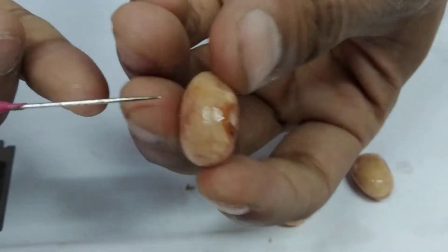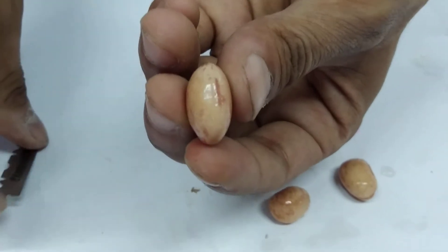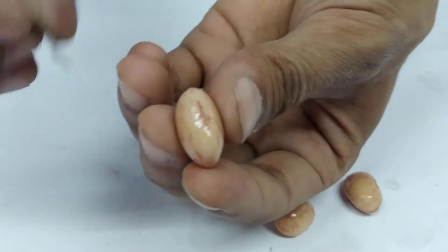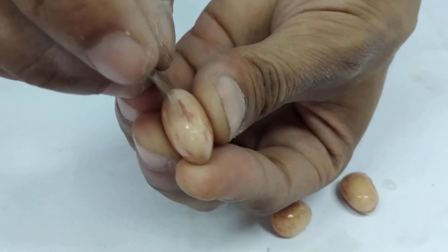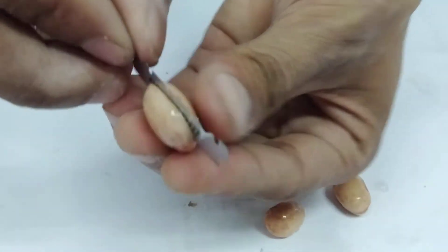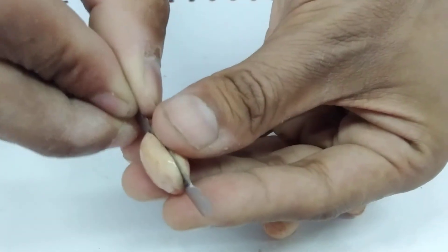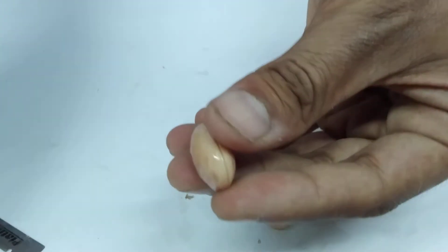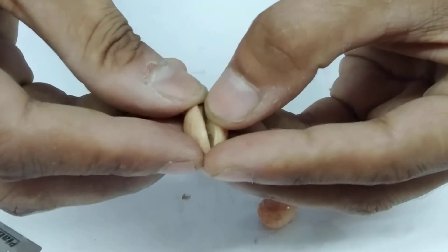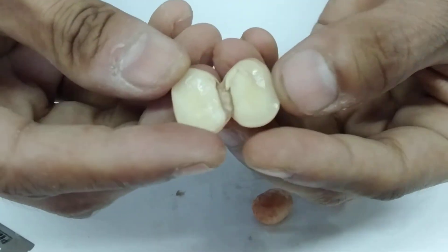What you're going to do is, on the opposite side, with the help of a blade, you're going to cut it. When you're cutting it, make sure you don't go right through the bean seed — it should still be connected at the other end.